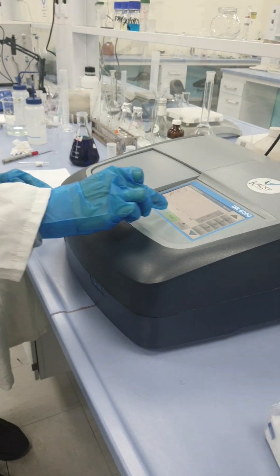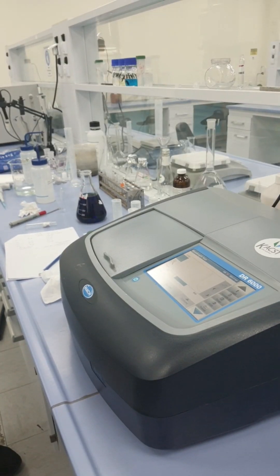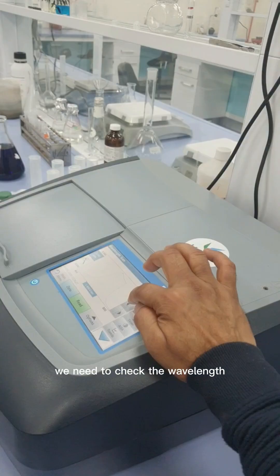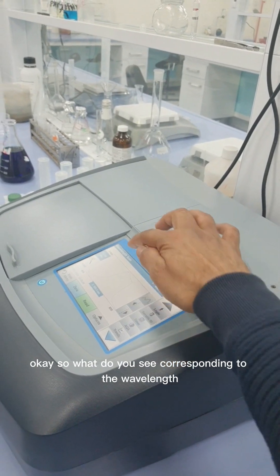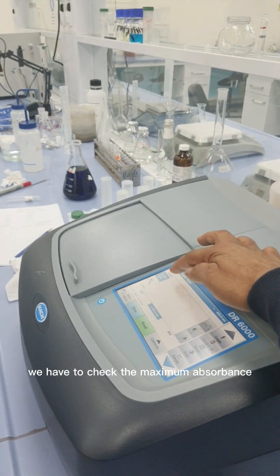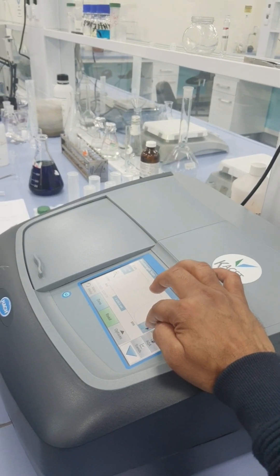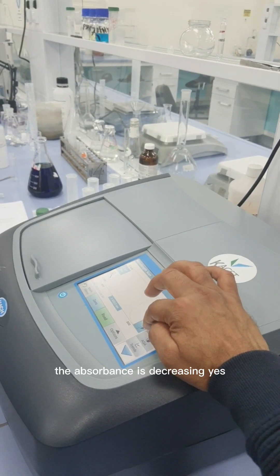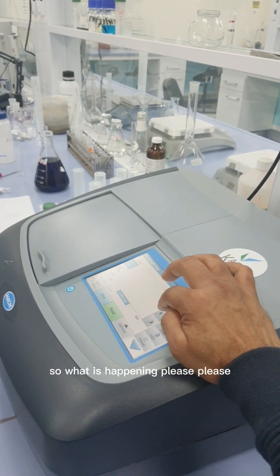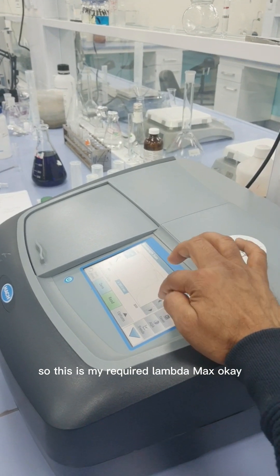Press the read button and wait a few minutes to get the absorbance peak. We need to check the wavelength corresponding to maximum absorbance — the lambda max. You can see that as we move away from the peak in either direction, the absorbance is decreasing.